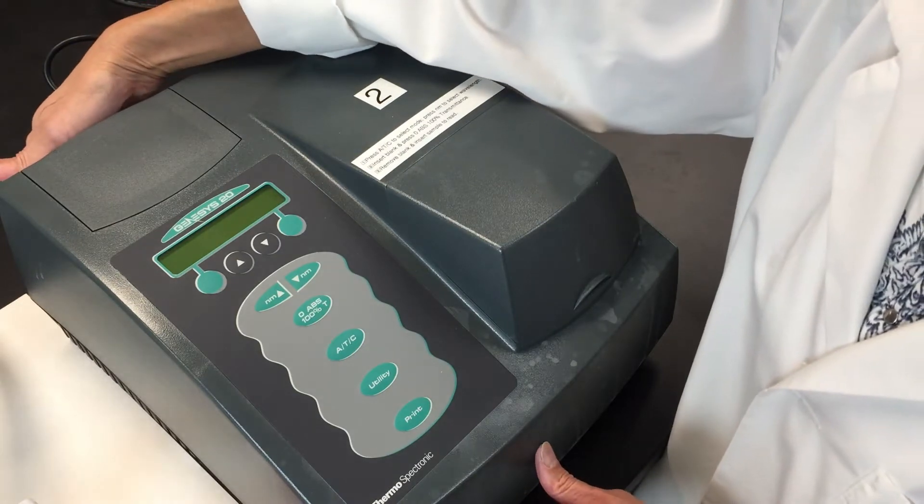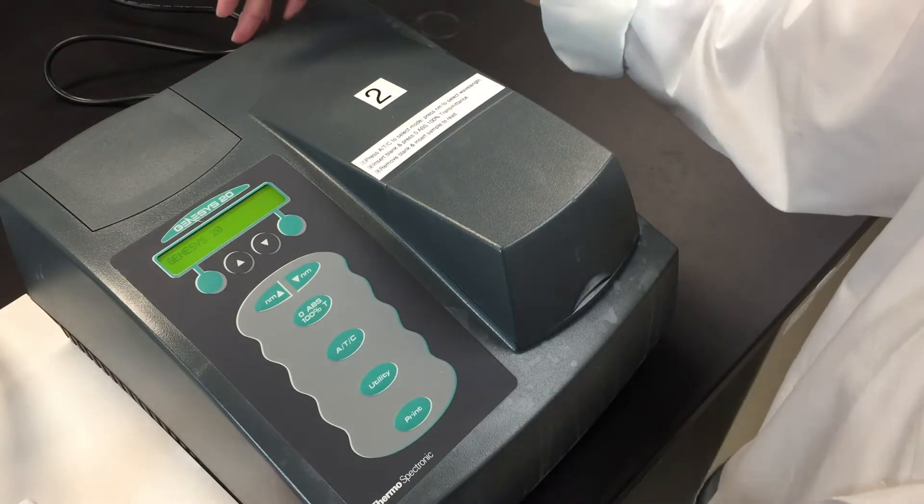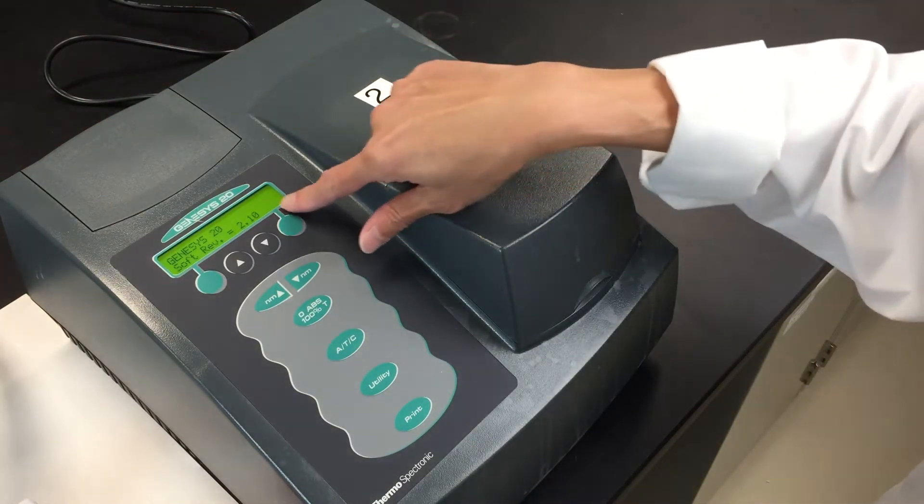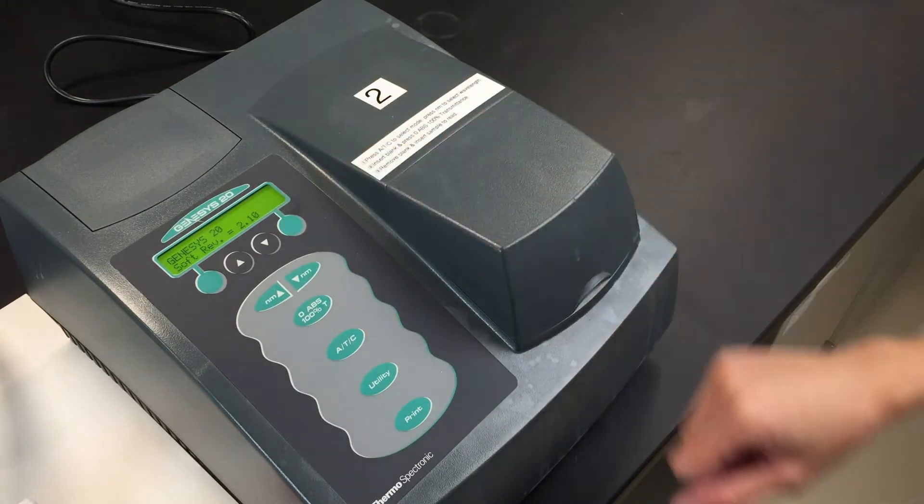Start by turning on your spectrophotometer and letting it warm up. This is what the screen looks like when you first turn it on.